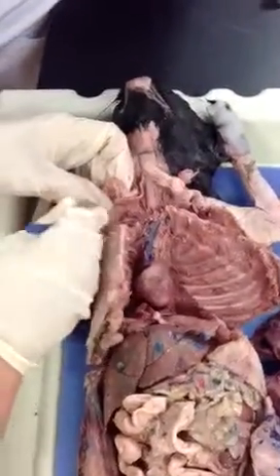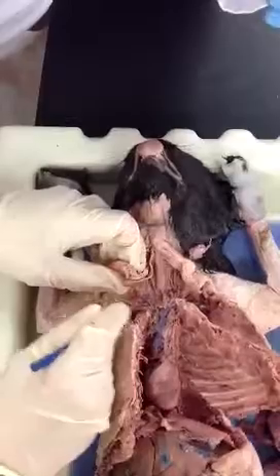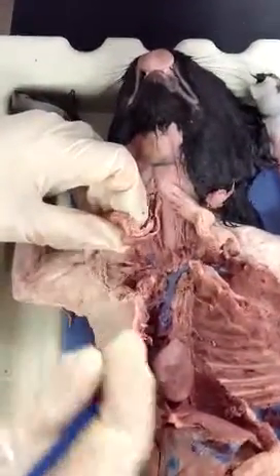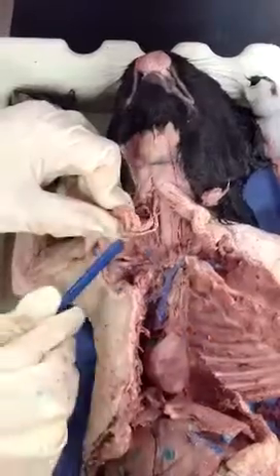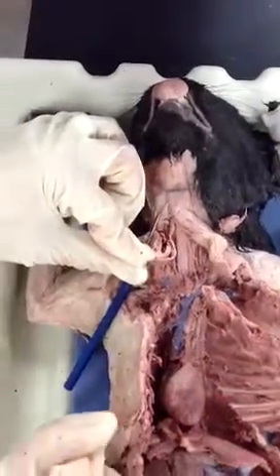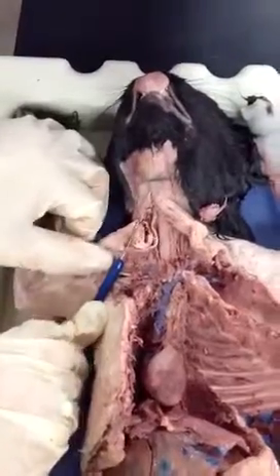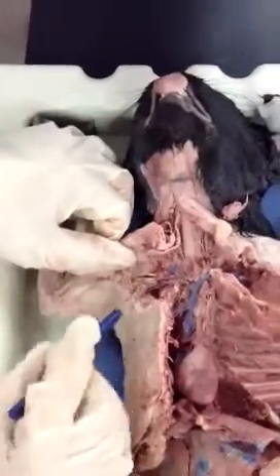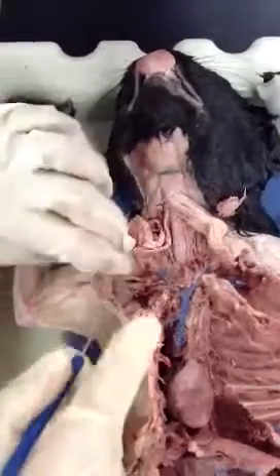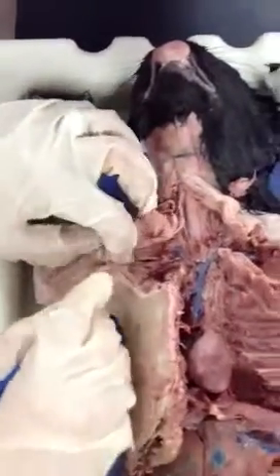So then you continue separating with the probe, and then immediately you notice that we see a blood vessel there. You see it? So what you're going to do is create an imaginary line, so you'll know that you're in the armpit. You draw it here. You see it? So once you draw that imaginary line, you know that this is going to be called your axillary.